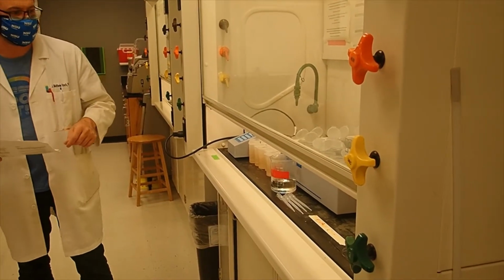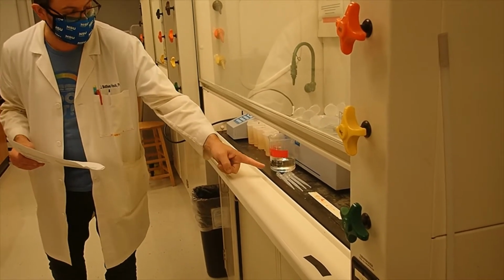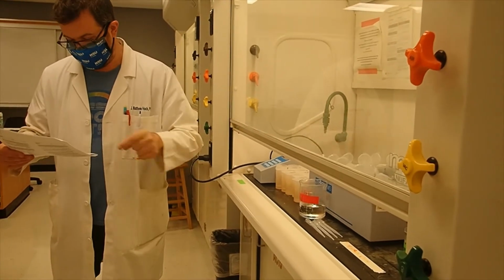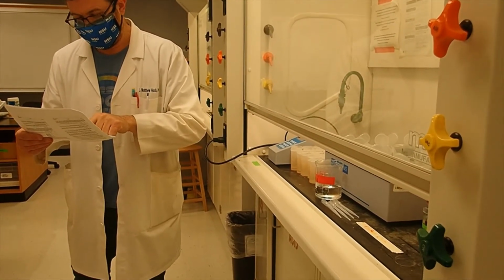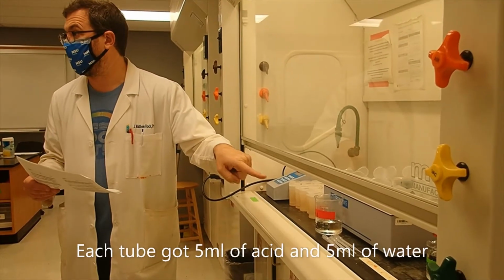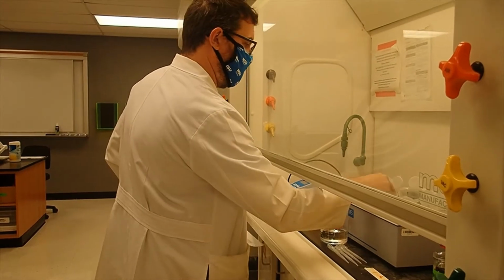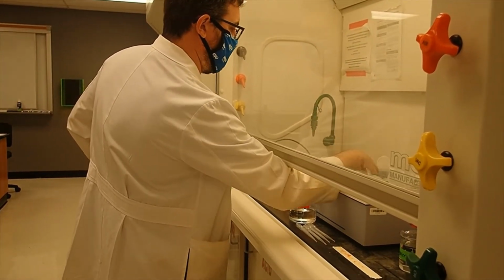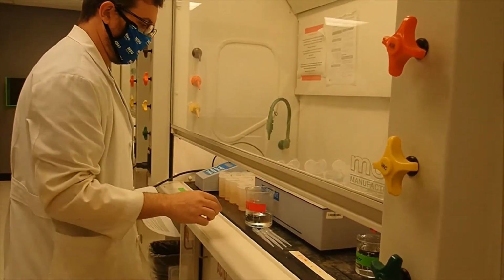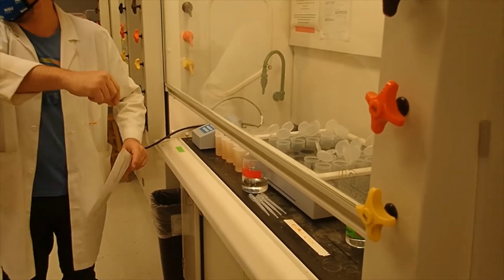So what you're going to do is these transfer pipettes, they're graduated up to 3 milliliters. Each of those tubes needs to have 5 milliliters of acid and 5 milliliters of water. So put the acid in first and then the water. And if we do it like this, there's an even number on either side. So move the acid so it's right in between so you don't have to reach over it.